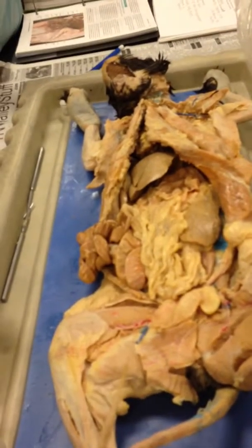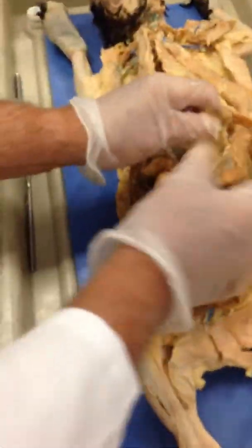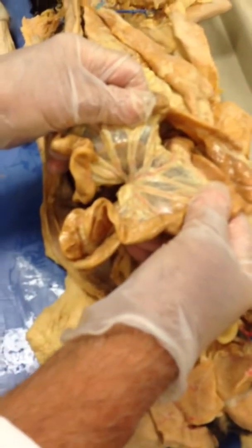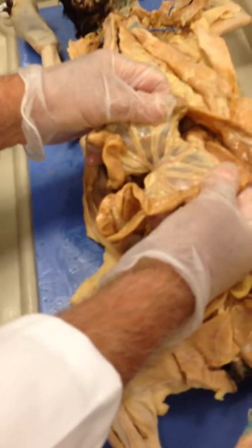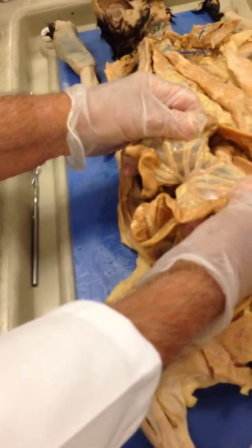And what were you saying about the mesenteric veins? Mesentery. This is all mesentery. See all of this connective tissue holding the intestines together? That's mesentery. You guys know that? He showed me that. Do you know that, Cameron? Since we're looking at over here, you knew that was mesentery, right?